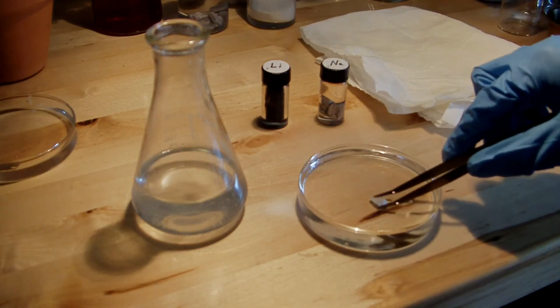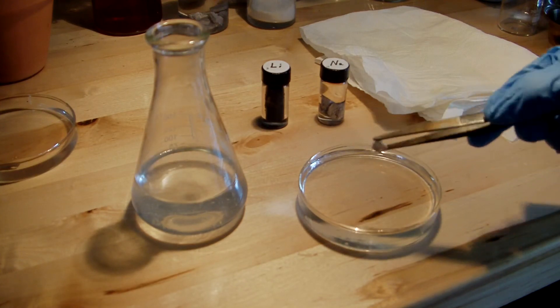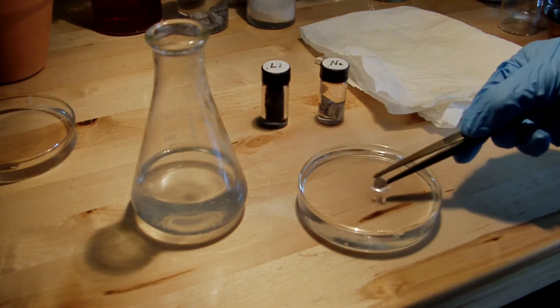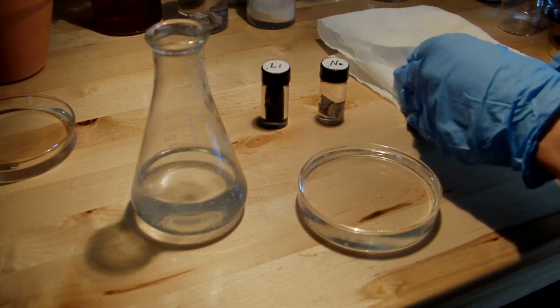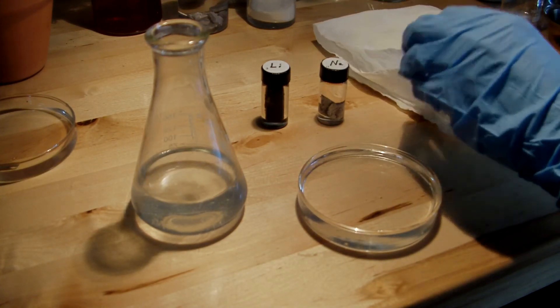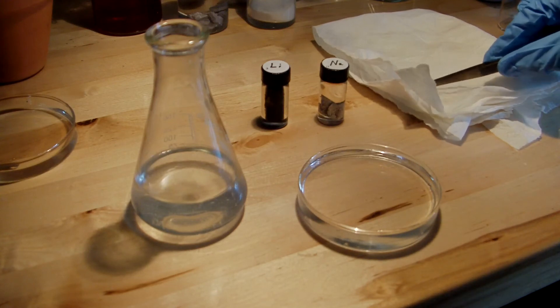Now sodium will undergo the same reaction but it will be quite a bit more vigorous and it obviously forms sodium hydroxide not lithium hydroxide.